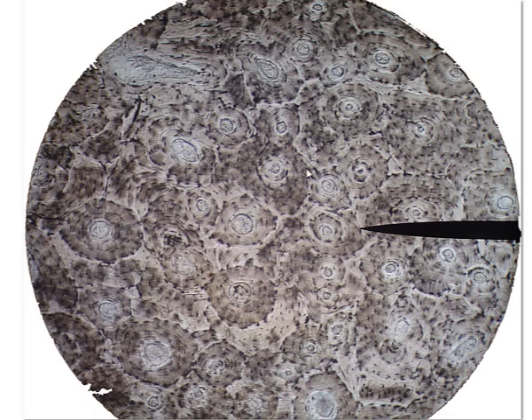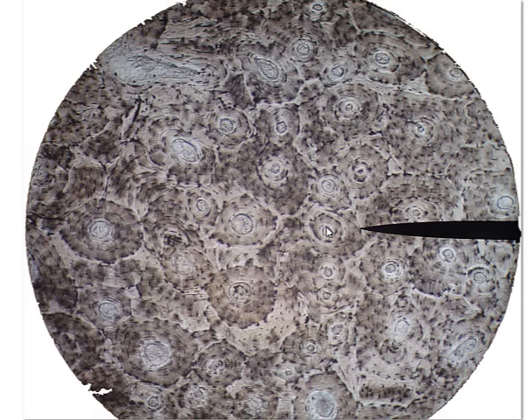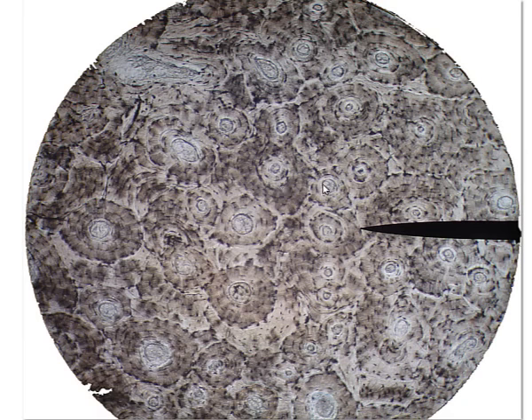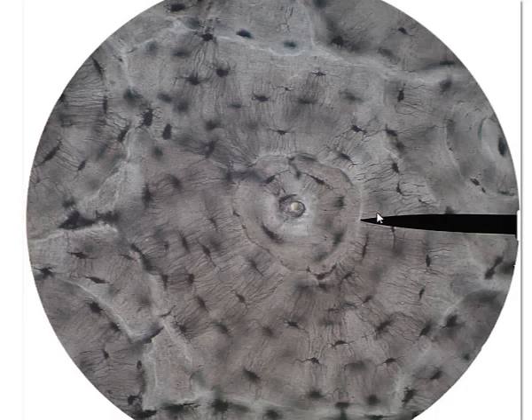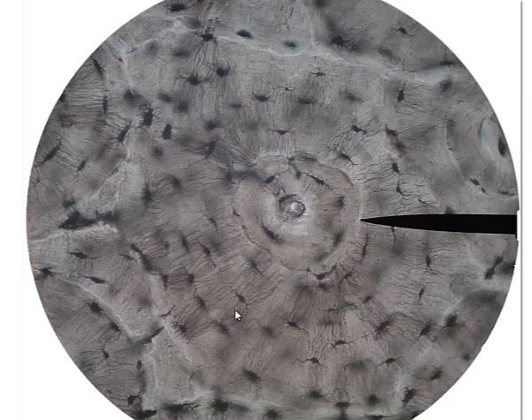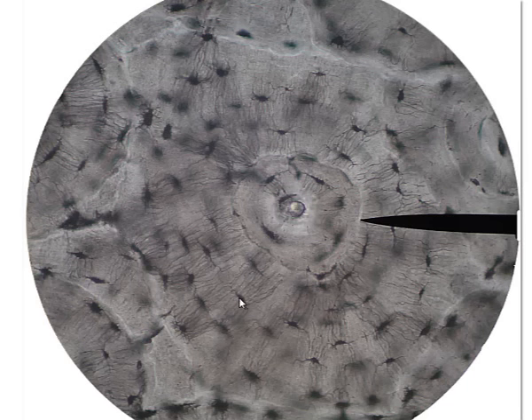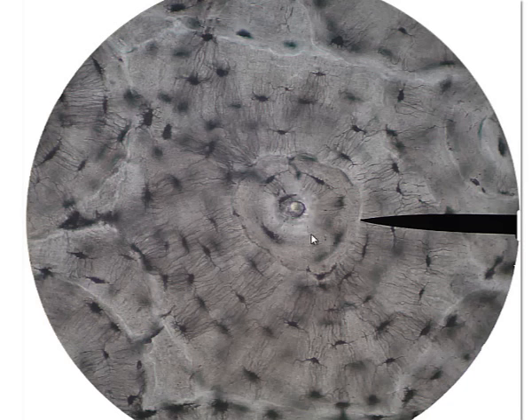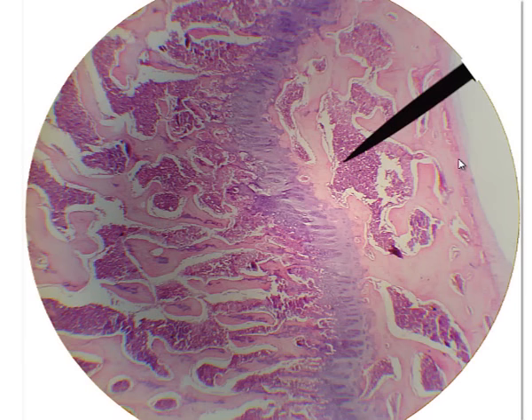This is bone tissue. The major feature you can recognize for bone tissue is these tree ring-looking structures called osteons. These osteons clearly indicate that this is bone tissue. At higher magnification we can see what makes up these osteon structures — compartments that cells are living in. The cells are called osteocytes and the compartments are called lacunae. That's what gives it that tree ring appearance. The key to recognizing this as bone tissue is that tree ring-looking appearance of the osteons.